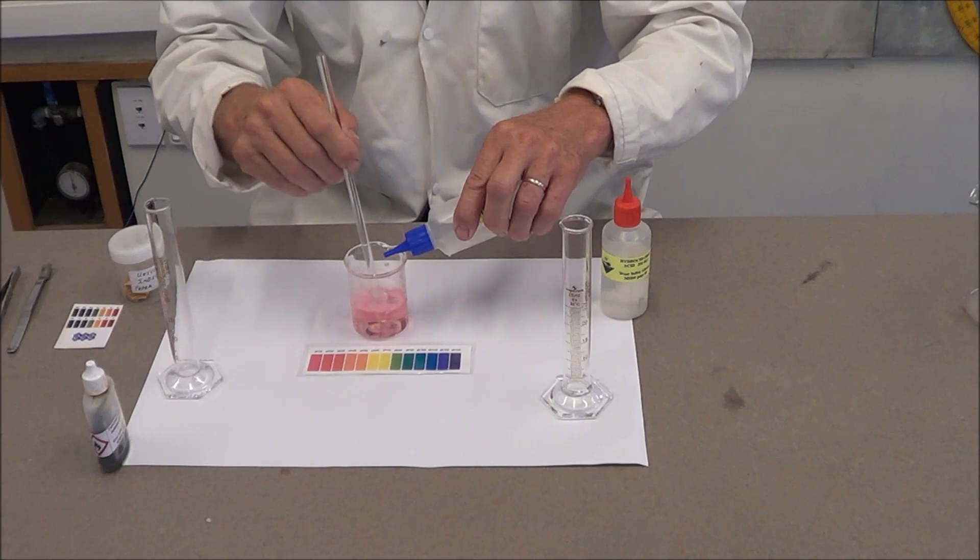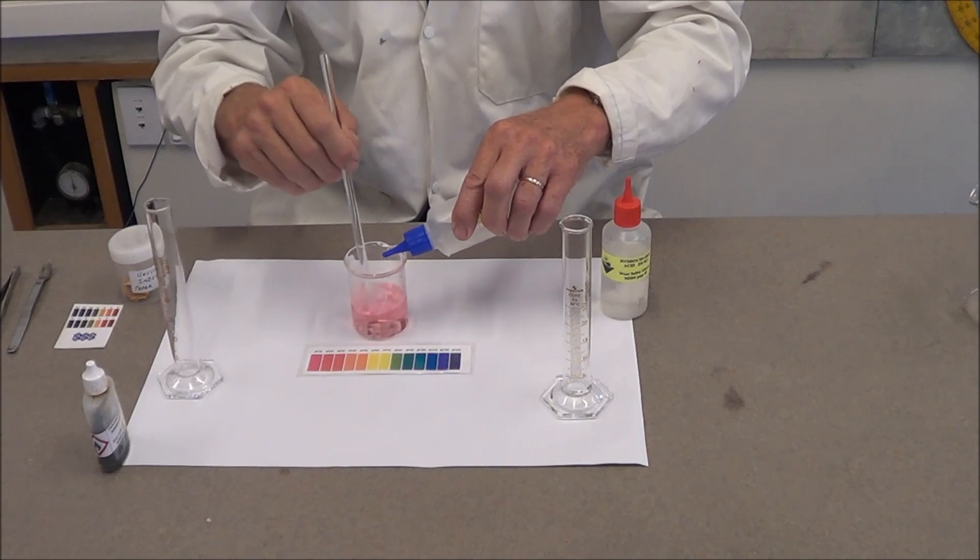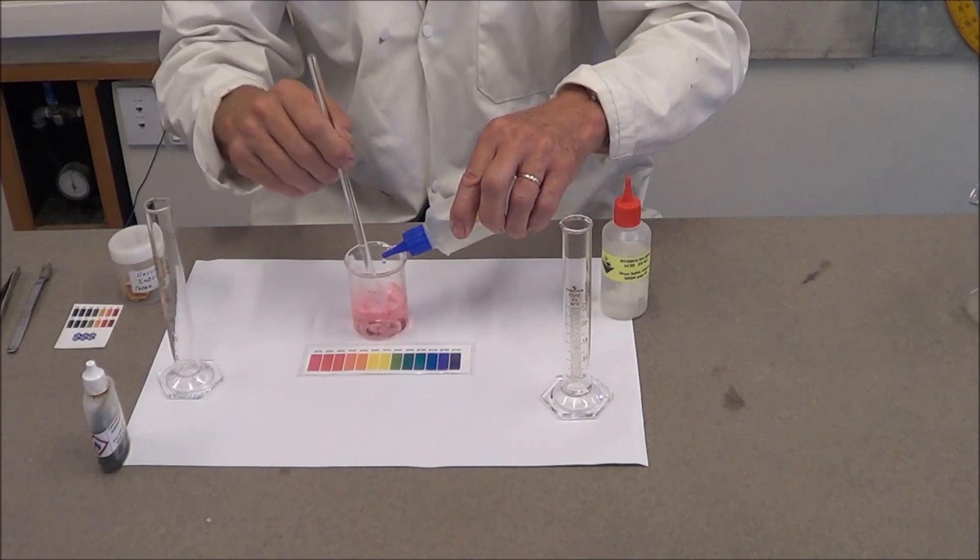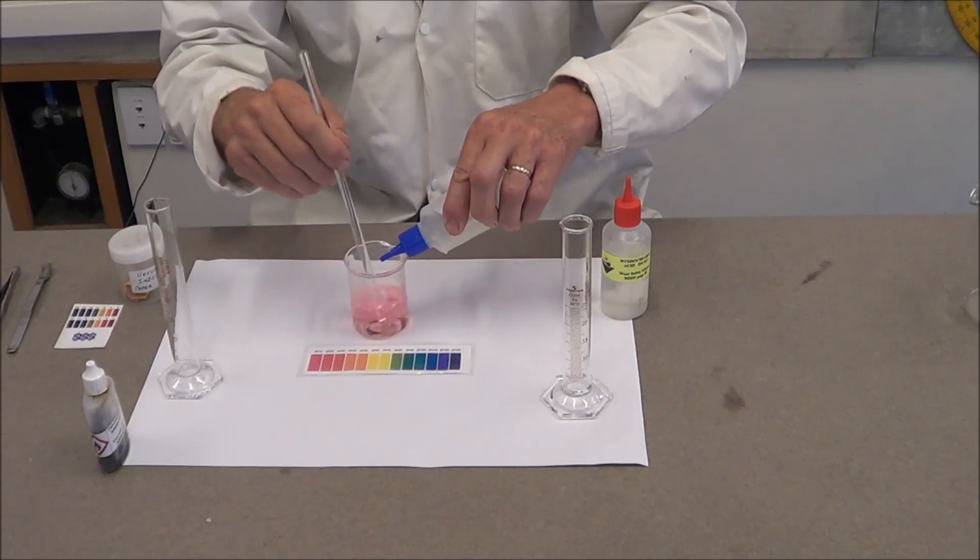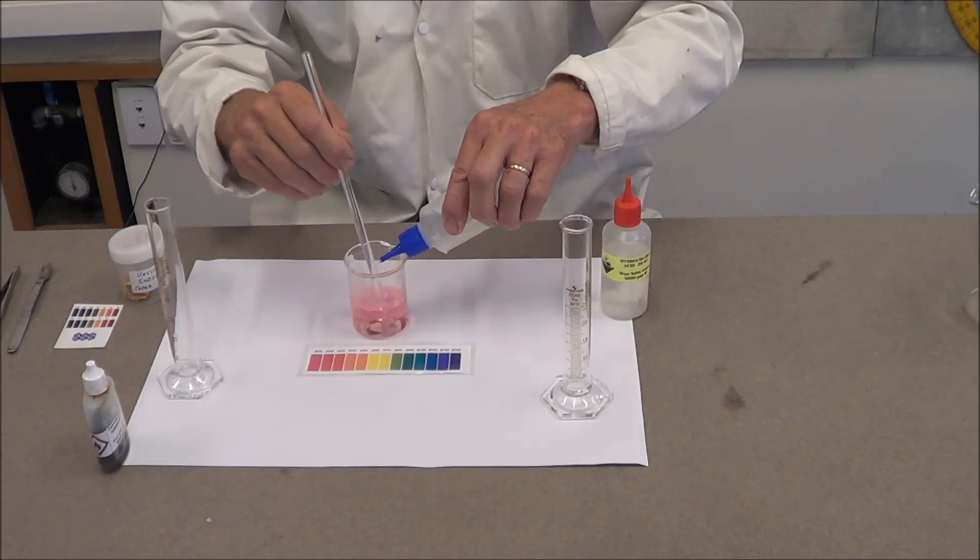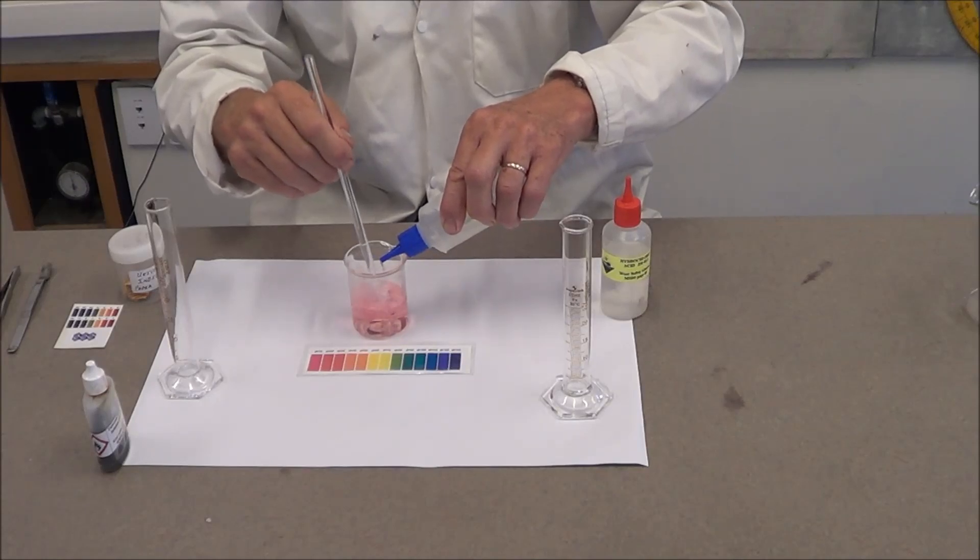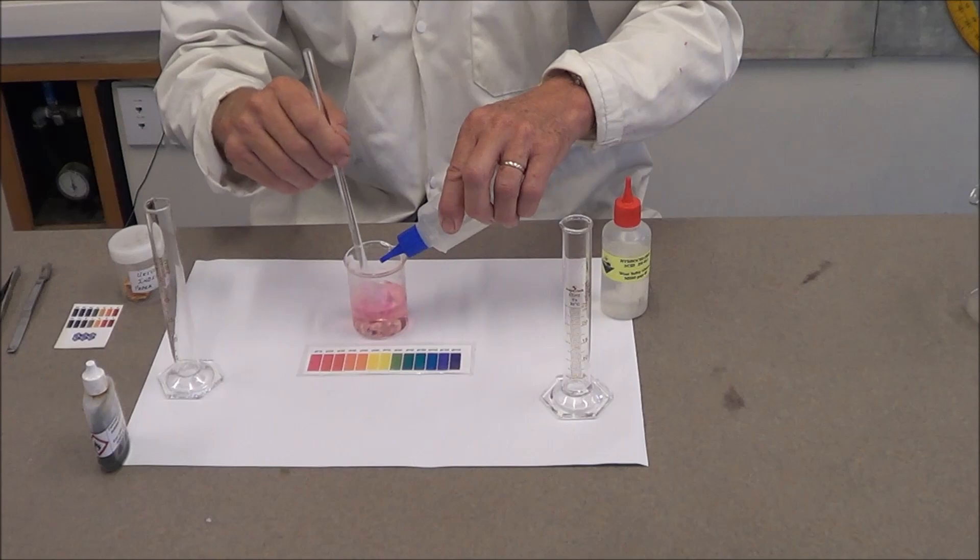Again, noting any color changes that occur along the way, as you may be required to explain what is causing the colors to change in terms of the acid particle, the hydrogen ion, and the base particle, the hydroxide ion.